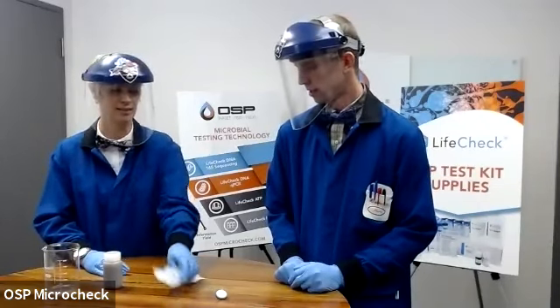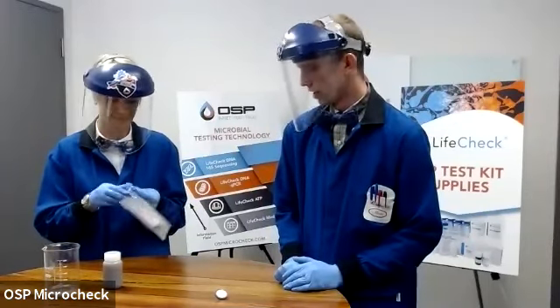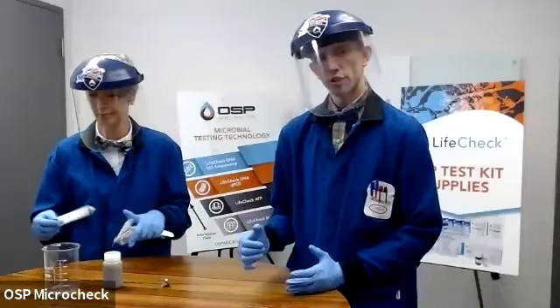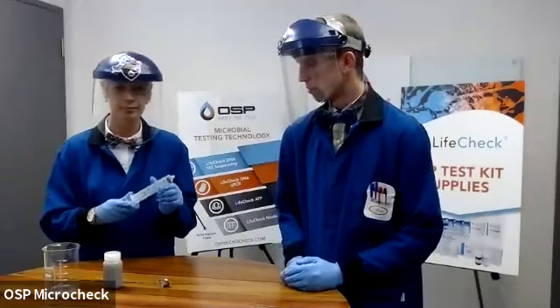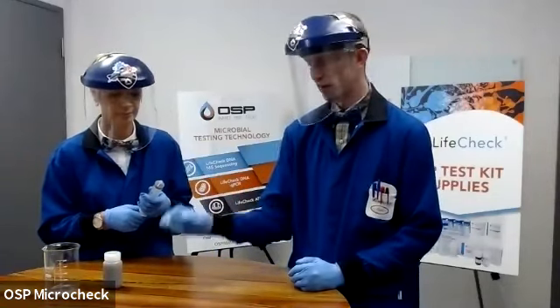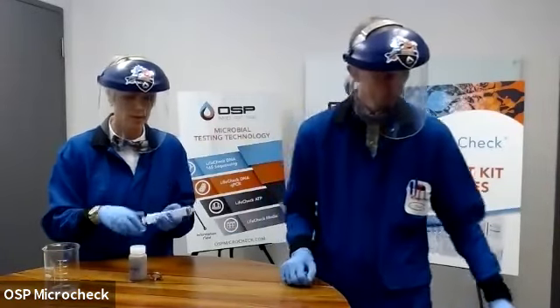All right, so I've provided Virginia here with a 50 ml syringe and a syringe filter. And the premise of what she's going to do here in this first step is syringe filter our liquid sample so that we can collect microbial cells on the surface of the filter membrane. So you can take your syringe and dip it into the sample and pull the sample up.